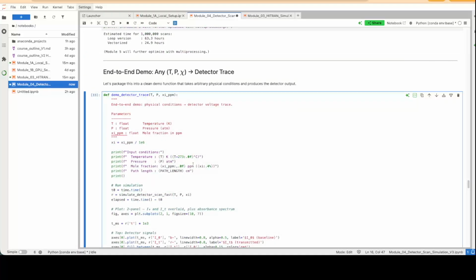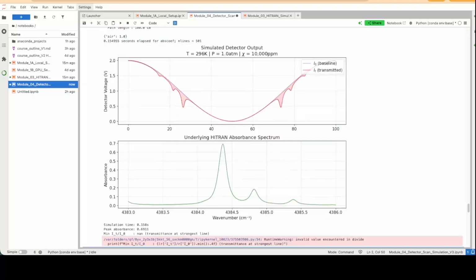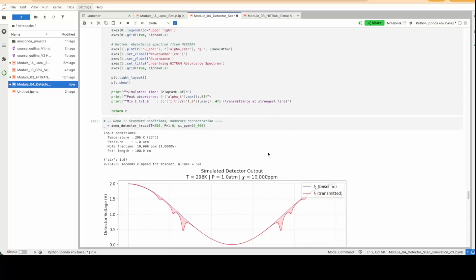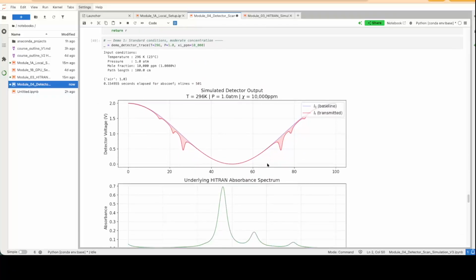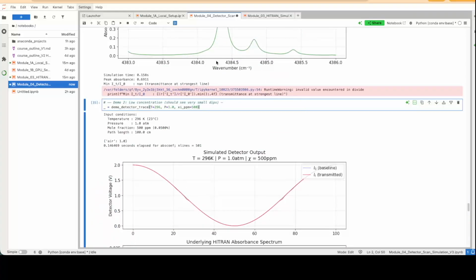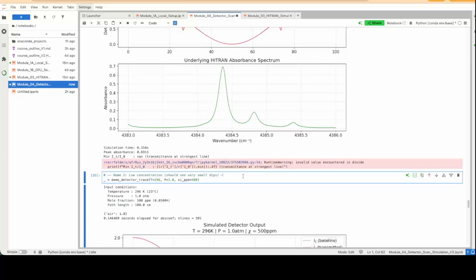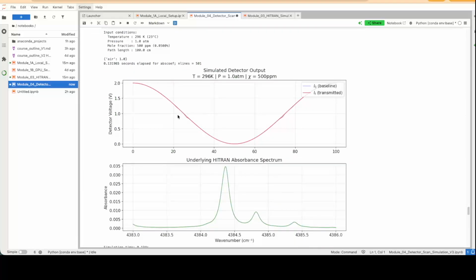Here is a demo to showcase what this looks like for a couple of different cases. Here's standard conditions, and it illustrates what the baseline versus transmitted intensity looks like. This error here has to do with getting down close to zero, where you have some NANs, and it doesn't like it when you divide by that. Another one here is a tiny dip in the transmitted intensity when your mole fraction is really small.